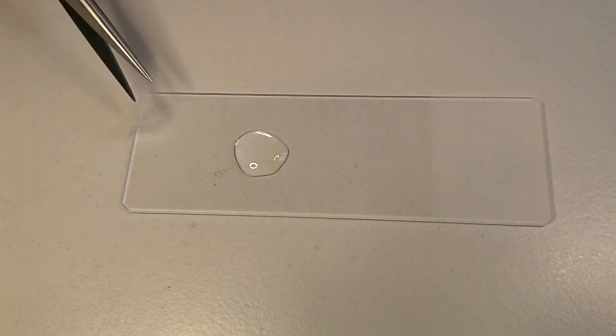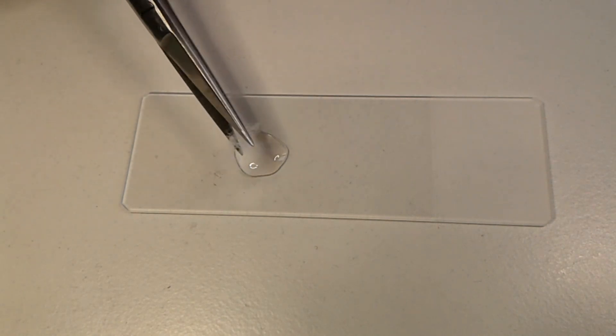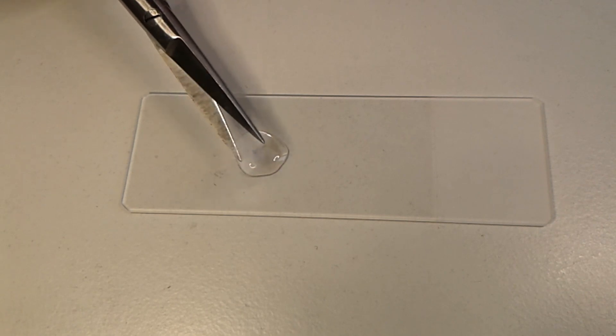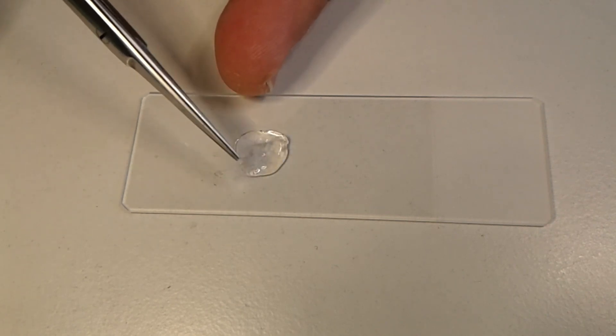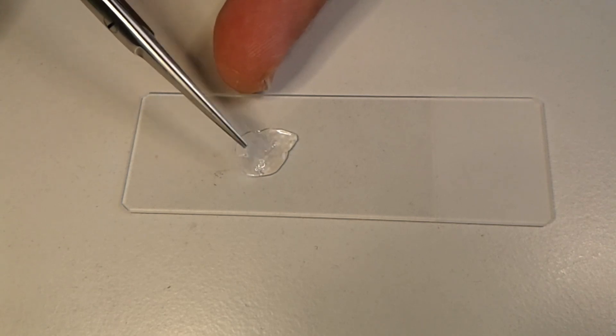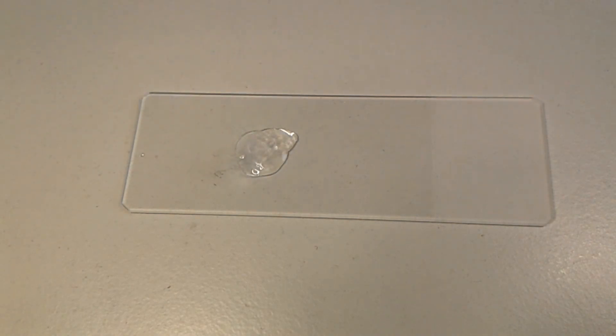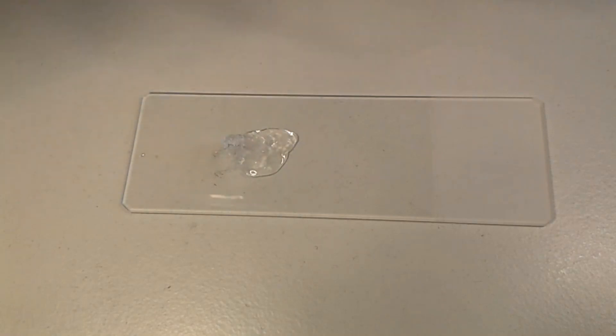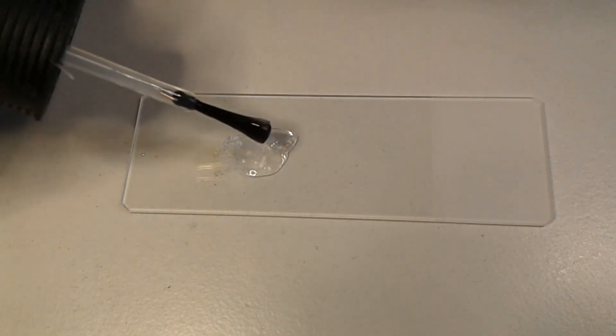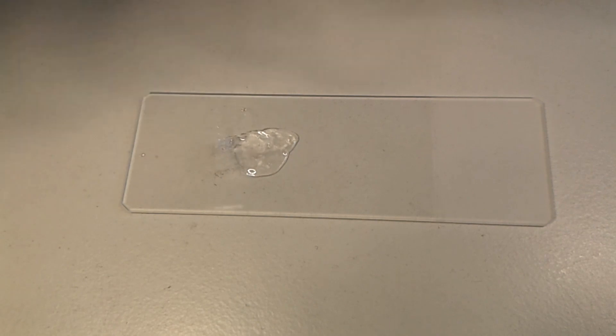Another reason why I'm using clear nail polish is because it is hydrophobic, and if these are indeed synthetic fibers, then they too are hydrophobic, so the mounting medium and the specimen, they should be compatible. If I were to use a water-based mounting medium, then the chances would have been pretty good that it would form a lot of bubbles. I do not know if this is going to work. Let's see.